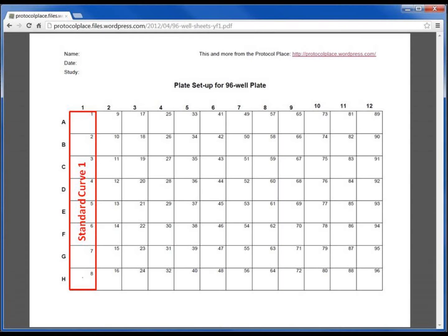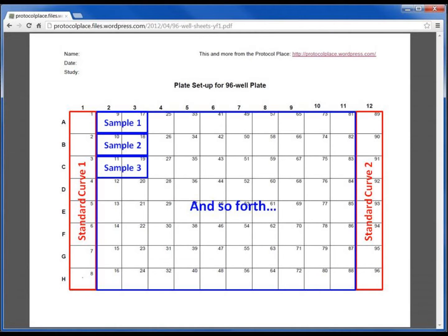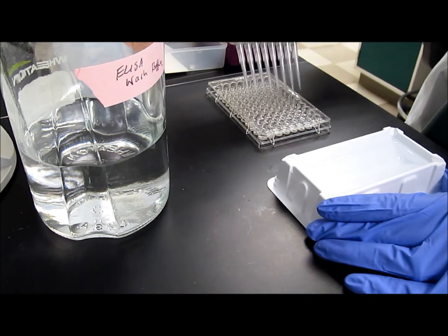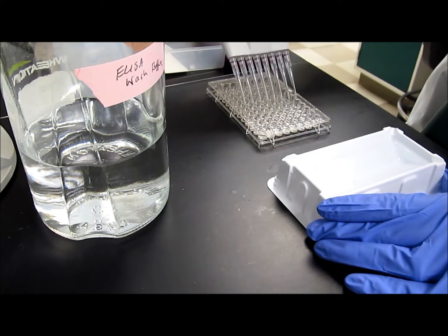Organizing samples and standards. I like to place my standard curves on the far left and far right sides of the plate, and my samples in the middle region. This way, when you wash the samples from one side to the other, one standard gets the first wash and the other gets the last. This will allow you to verify that measurements aren't varying from one side of the plate to the other due to time delays in the various steps.